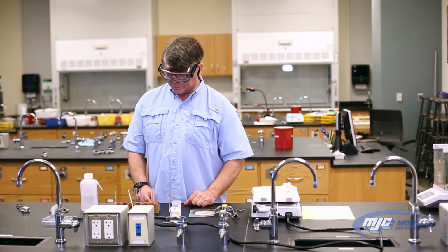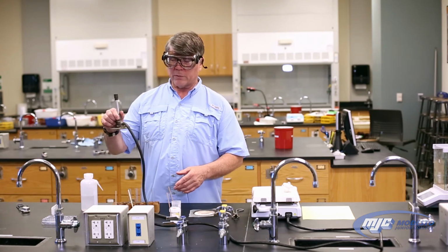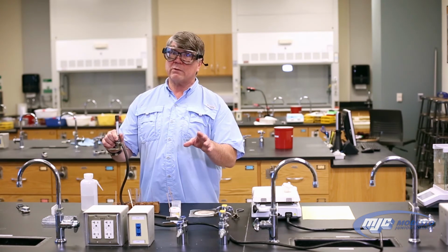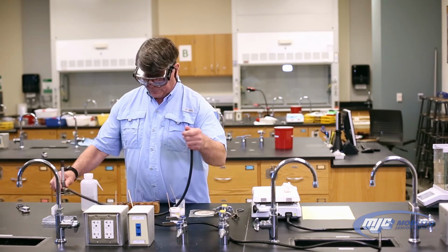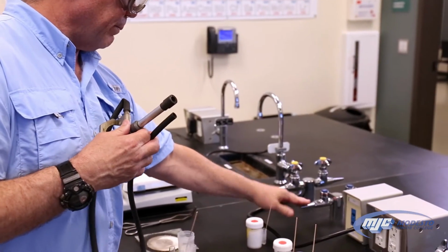So, first thing though, is we're going to use a Bunsen burner to do the flame test, and we haven't used that yet in this class, so I need to explain how to use it and how it works. So, Bunsen burner, it's like this, comes with a hose, attaches to a gas outlet here.